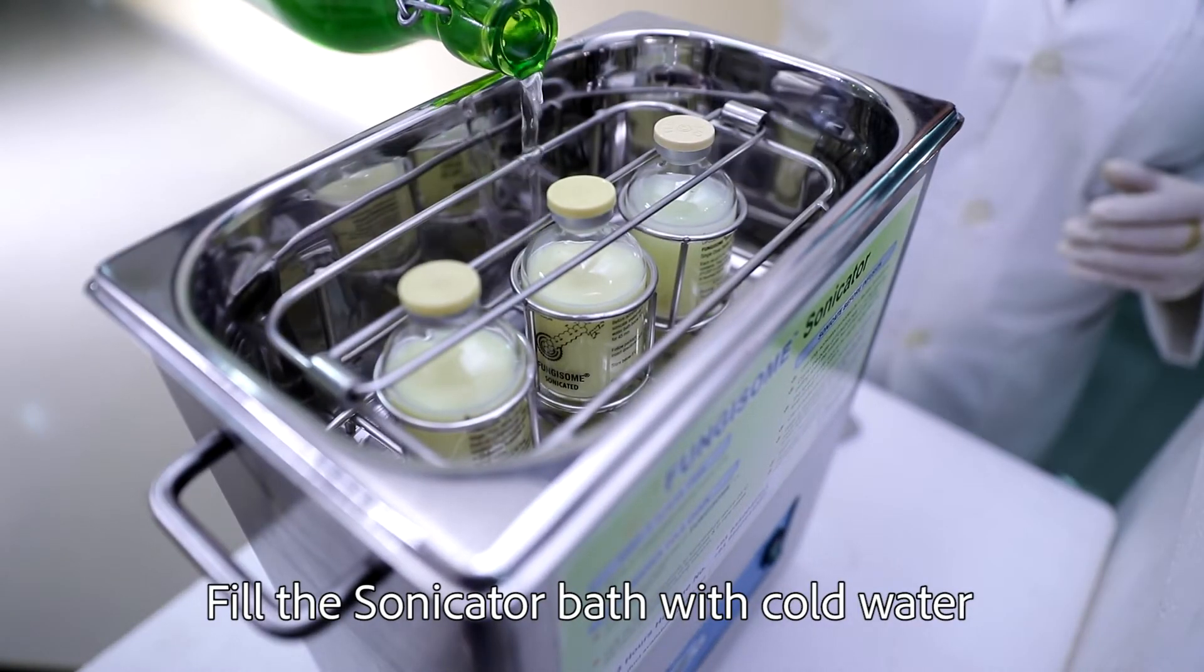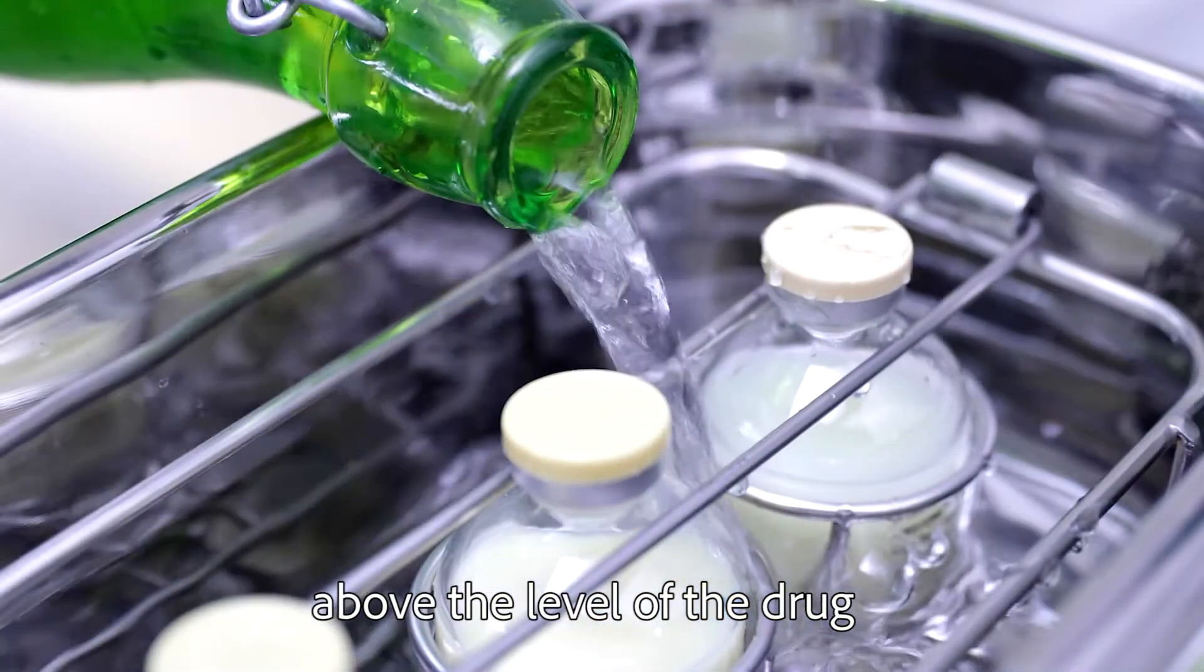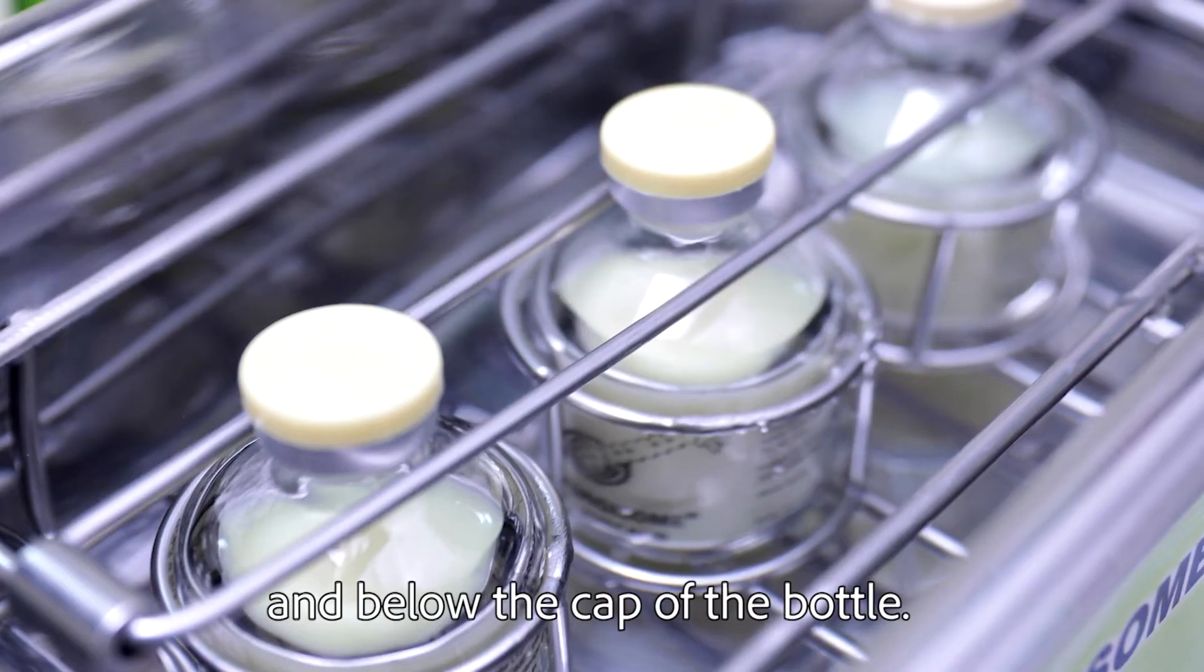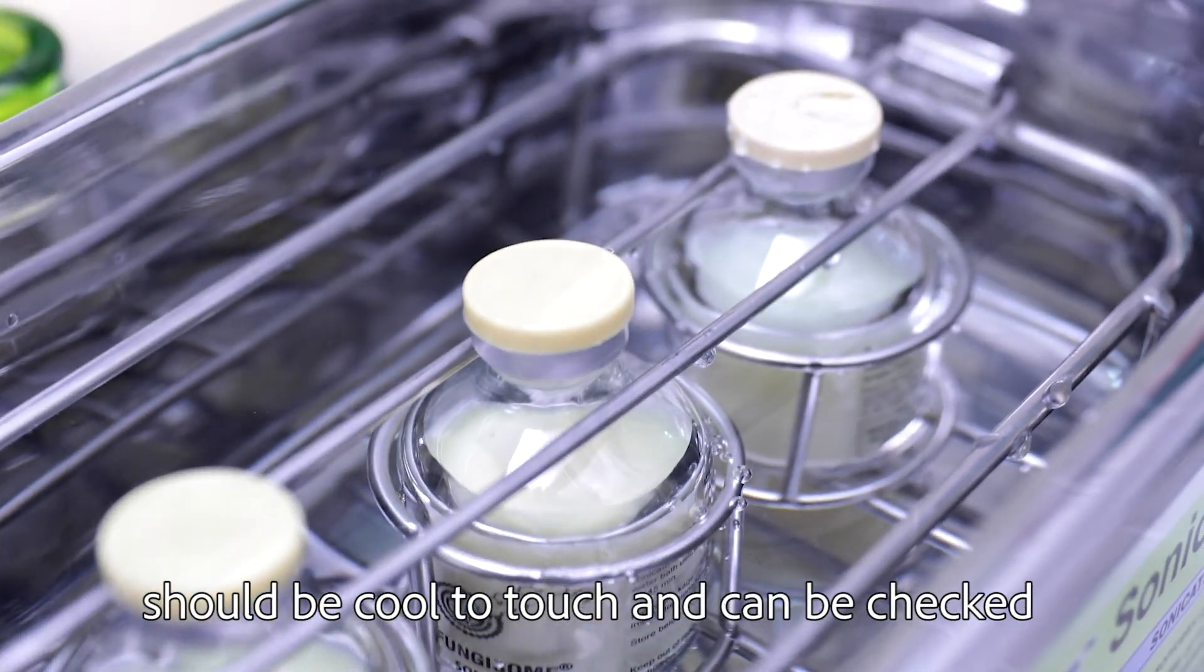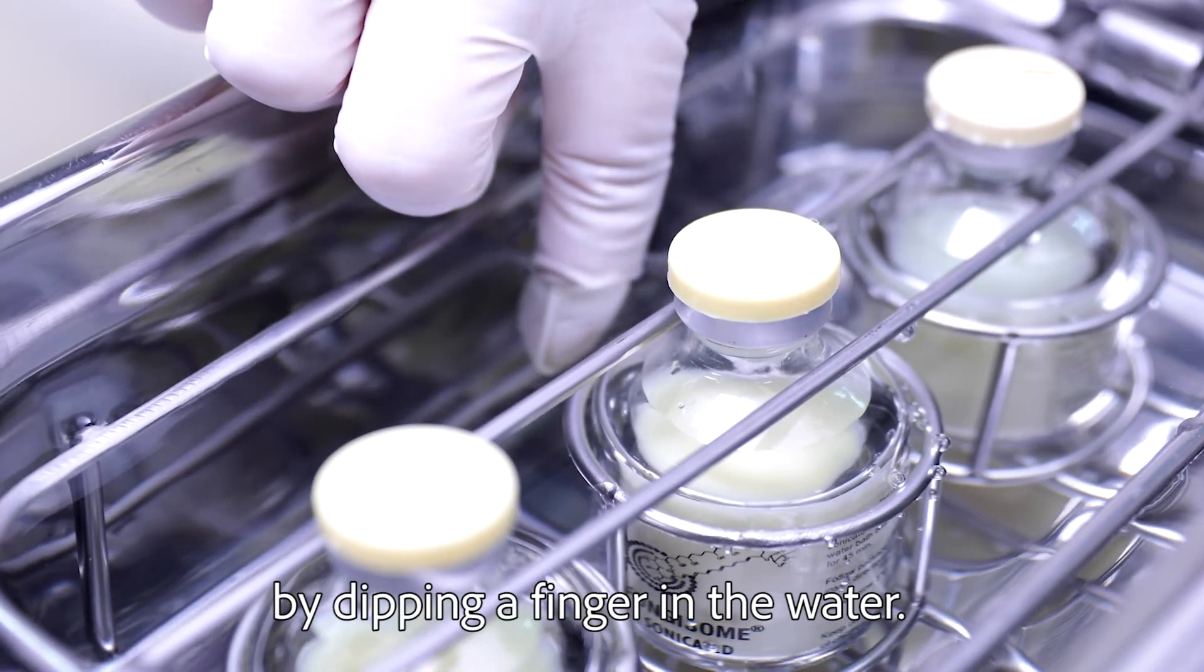Fill the Sonicator bath with cold water above the drug level and below the cap of the bottle. During sonication, the water temperature should be cool to touch and can be checked by dipping a finger in the water.